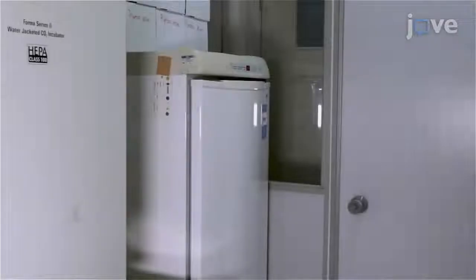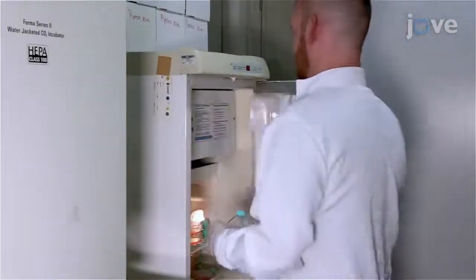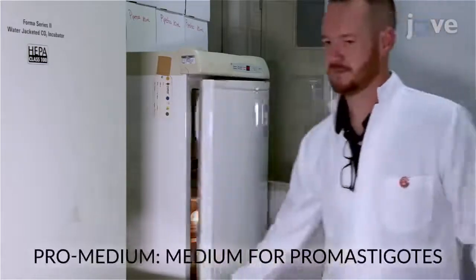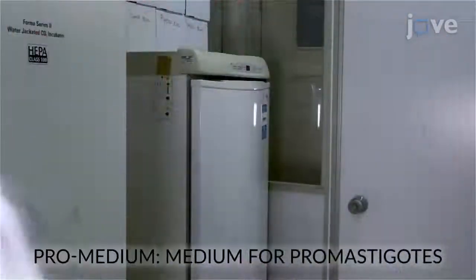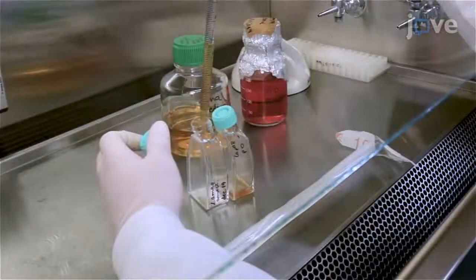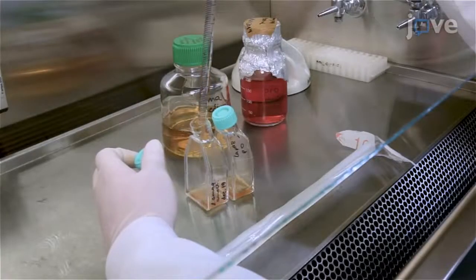Start by growing L. amazonensis promastigotes in a 25 cm squared cell culture flask containing 10 ml of promedium for 3 days at 25 degrees Celsius. After the incubation, pipette 5 ml of logarithmic growth phase promastigote culture into a new flask.